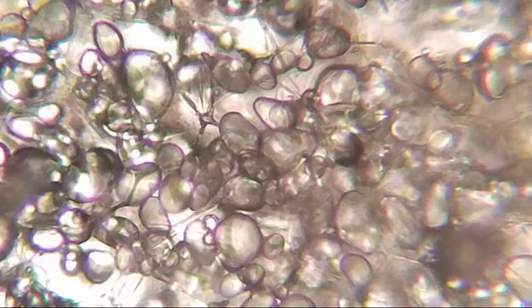Carry out the following 6 steps in order to examine the sediment produced during the first centrifugation. Use the pipette to remove a sample of sediment from the bottom of the first centrifuge tube. Note, you may need to carefully pour out a little of the liquid in the tube in order to prevent a spill. Place a drop of the sediment on a slide and carefully cover it with a cover slip. Use the scanning objective of the microscope to examine the sediment. Note, it will be difficult to identify structures.